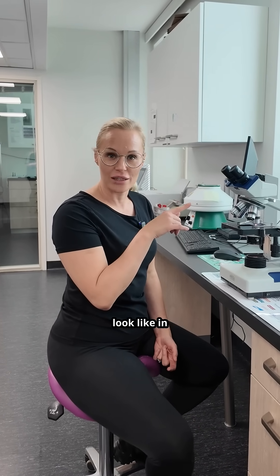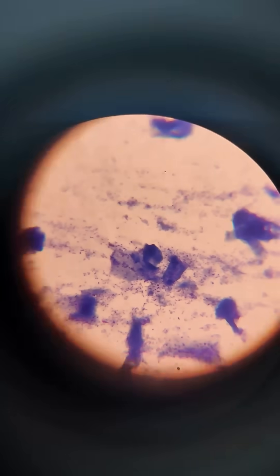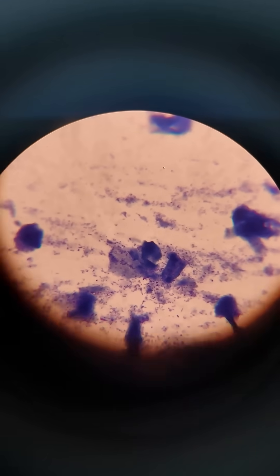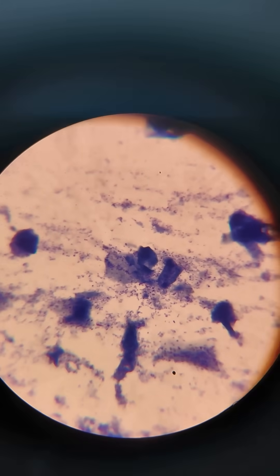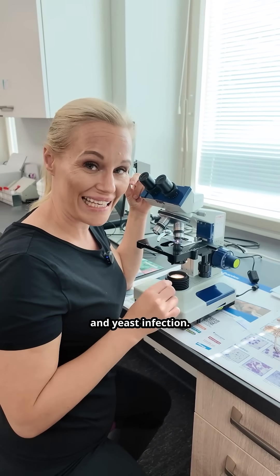Here I can show you what bacteria look like in the microscope. And then I'm going to show you what it looks like when we have a bacteria and yeast infection.